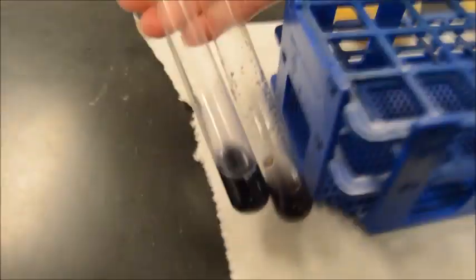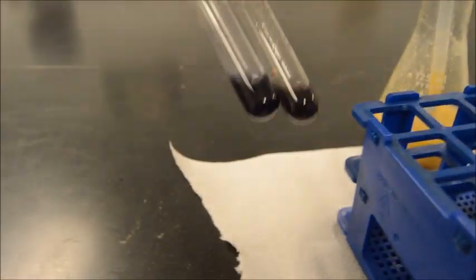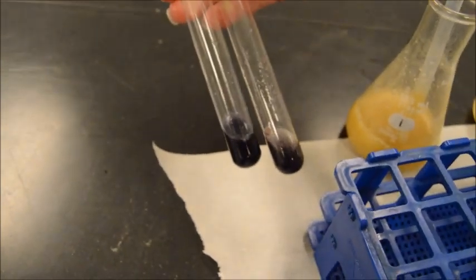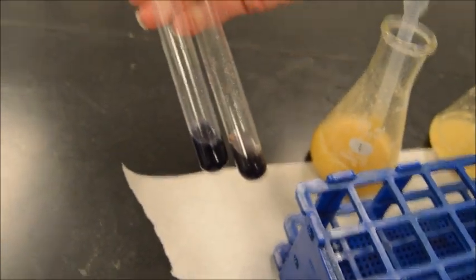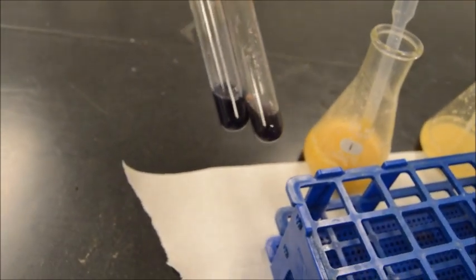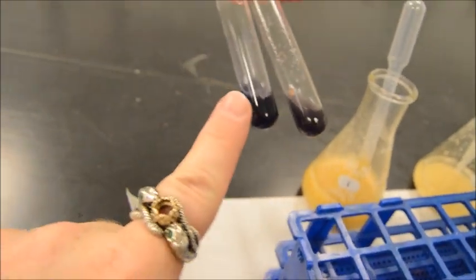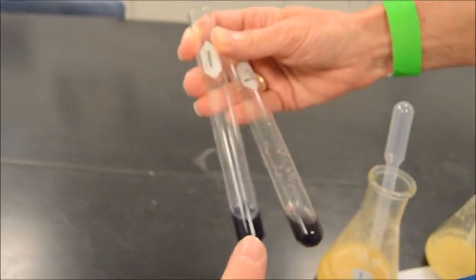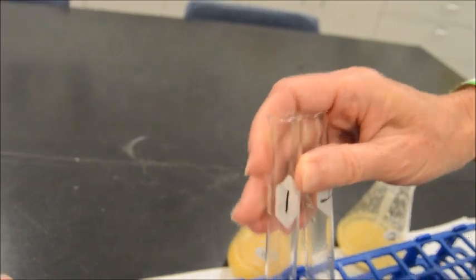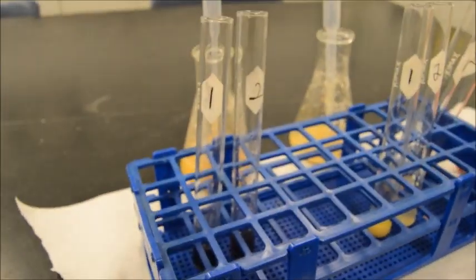And as I'm sitting here in person, folks, it's hard to see that on the camera, but the first one here, number 1, is very dark indeed, and the second one here, number 2, is not as dark from my perspective. Would you agree with that, Ms. Rose? It's not as dark through the solution. All right, so number 1 has lots of starch from my perspective, and number 2 would have less, which, considering what we saw in our previous experiments, is telling. It tells us something. All right, and that is our test for starch using iodine.